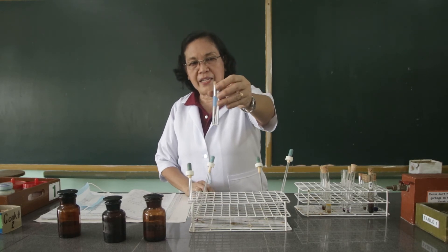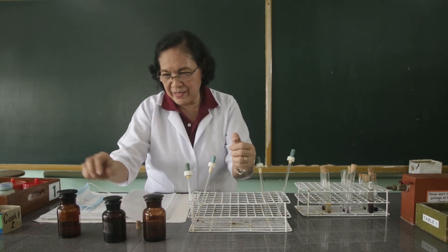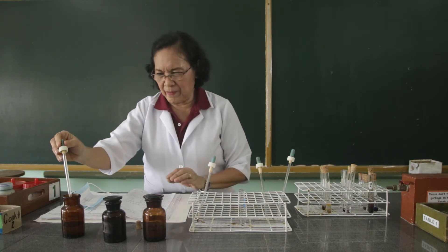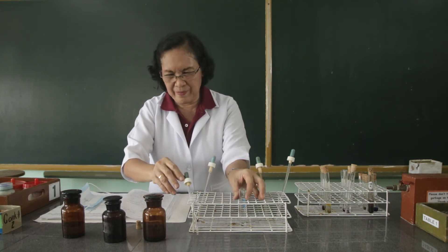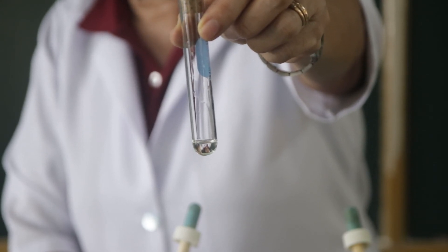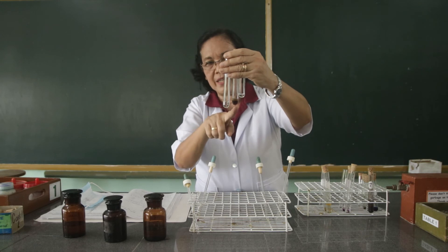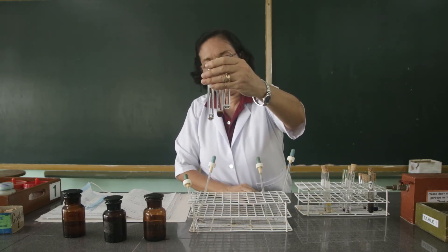Then we are going to add the acetylene gas with the sulfuric acid. Observe what happens. This test tube contains the cyclohexane added with the sulfuric acid. This is the cyclohexene added with the sulfuric acid. And this is the acetylene gas added with the sulfuric acid. Observe.